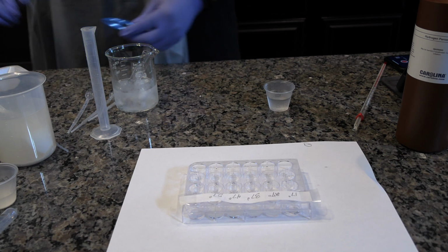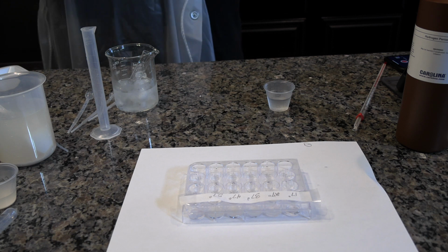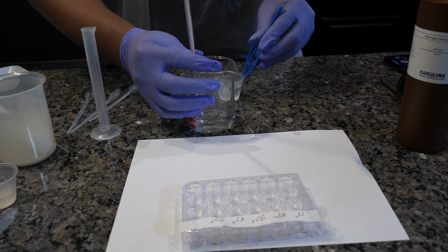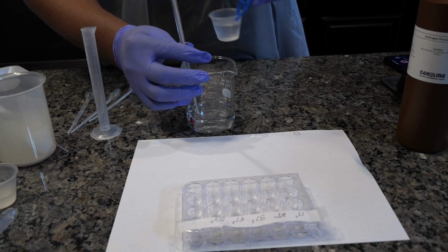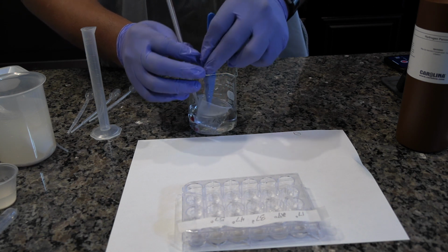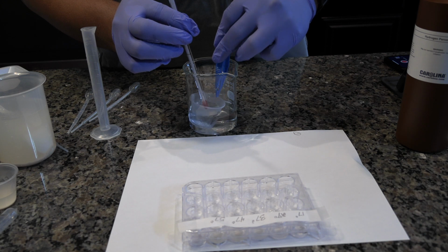For temperatures above room temperature, set up a water bath by adding hot tap water to the beaker. Insert a thermometer into the water bath to track the temperature. Adjust the temperature by replacing some of the hot water with cooler water until the desired temperature is achieved. Total volume of the water in the beaker should be approximately 50 milliliters. Record the actual temperature in data table 2.